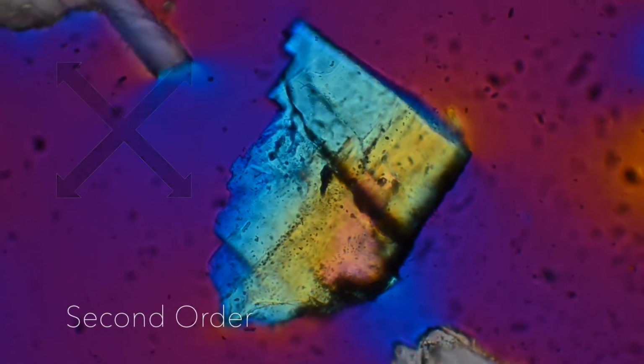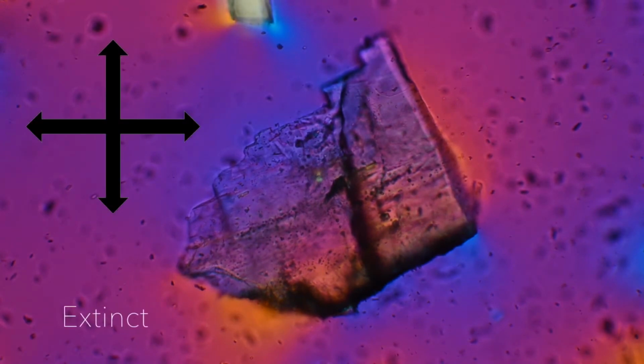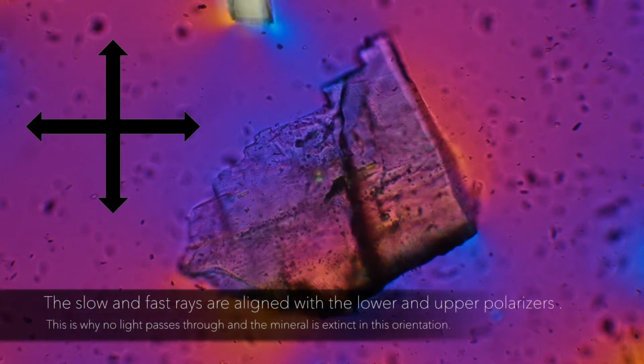Now, I'm going to rotate the stage 45 degrees to observe what this mineral looks like in an extinction position with the accessory plate inserted. You'll notice that it is magenta instead of black. The slow and fast rays are aligned with the lower and upper polarizers. This is why no light passes through and the mineral is extinct in this orientation.